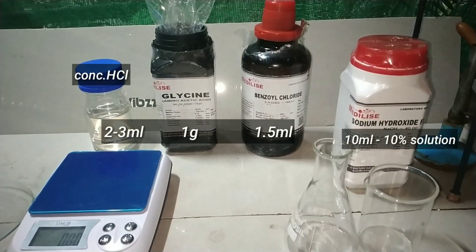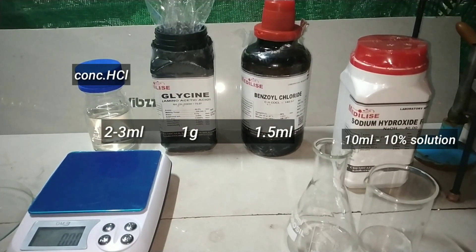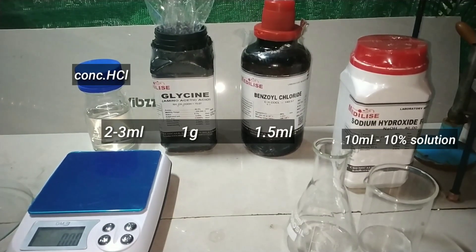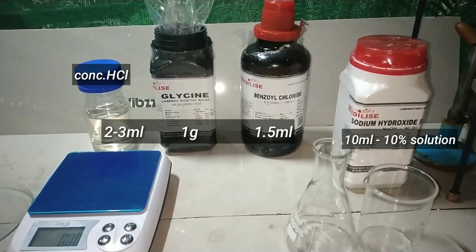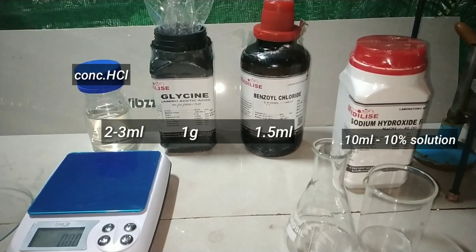These are the materials required for this synthesis: Glycine, Benzoyl Chloride, Sodium Hydroxide, and Concentrated Hydrochloric Acid.